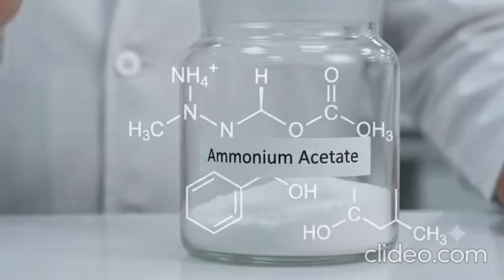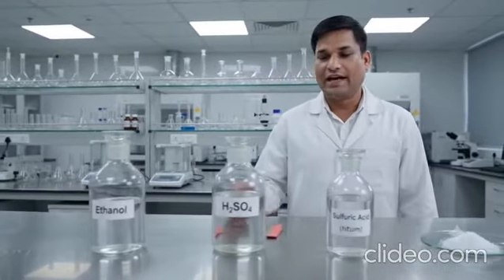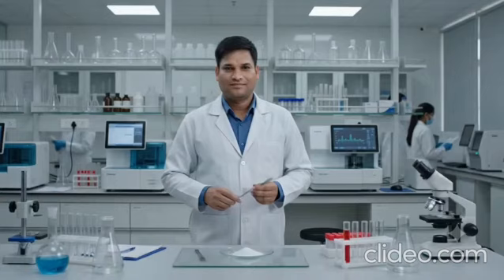Today we will perform the salt analysis of ammonium acetate, CH₃COONH₄. Our aim is to identify the basic radical and the acidic radical present in the given salt. Required chemicals are sodium hydroxide, ethanol, concentrated sulfuric acid, red litmus paper, and the given salt sample.